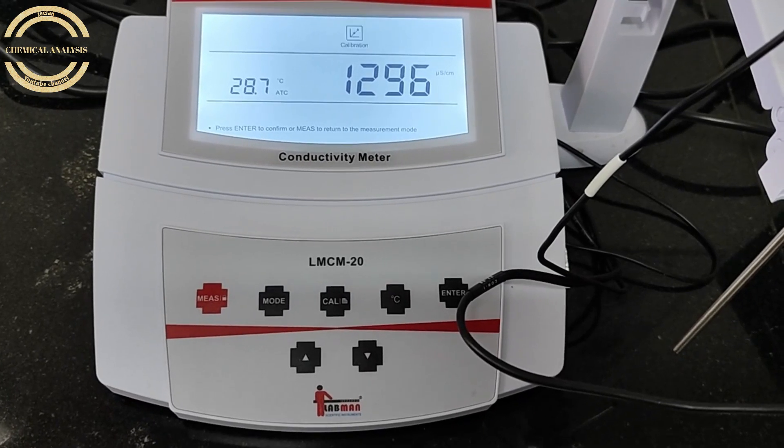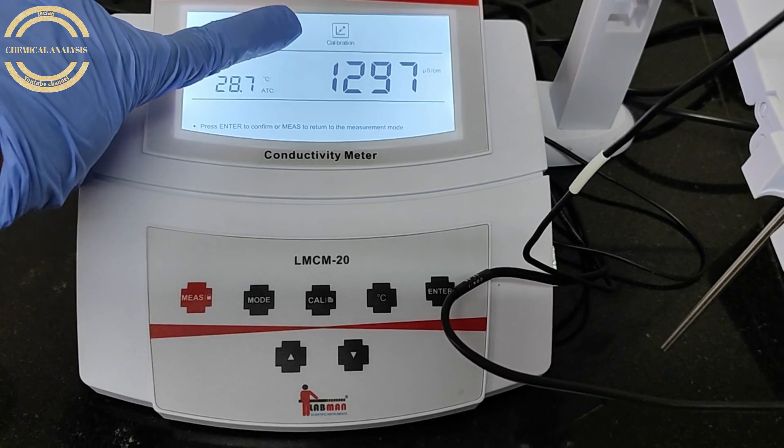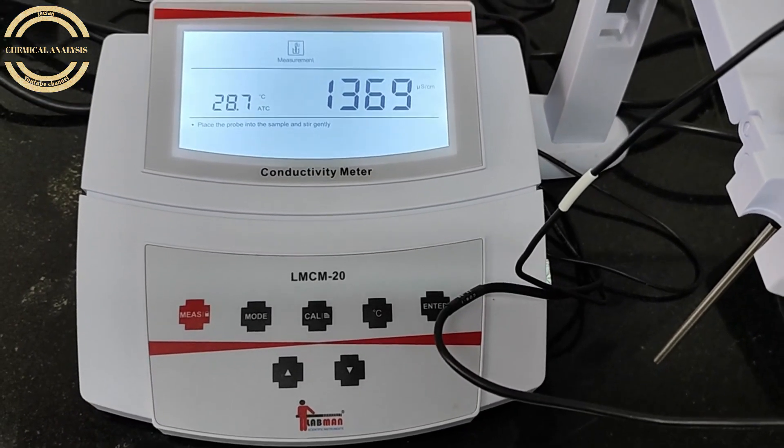After calibration, we cross-check whether the instrument is calibrated or not. Take the same CRM solution and put the electrode in to check.